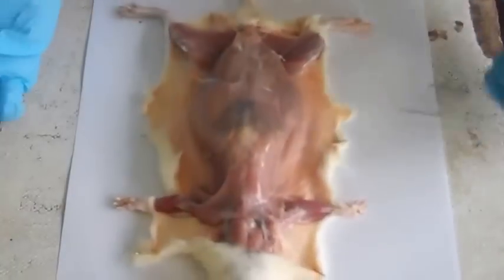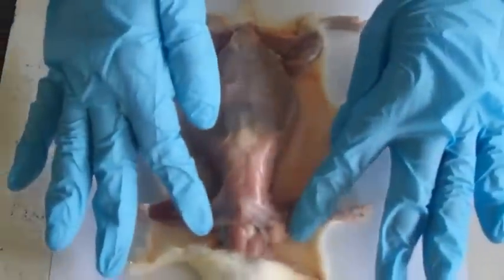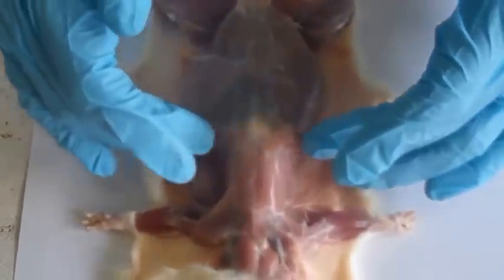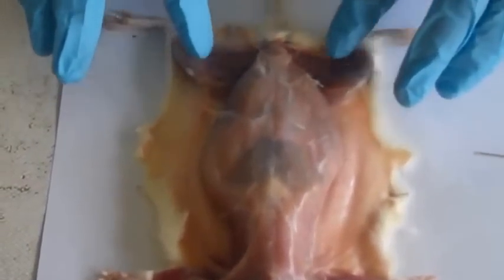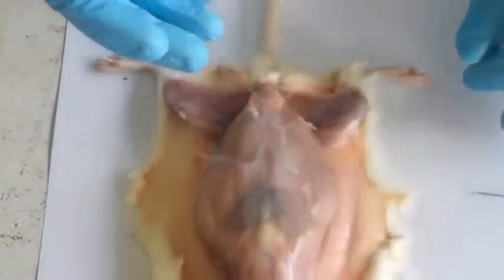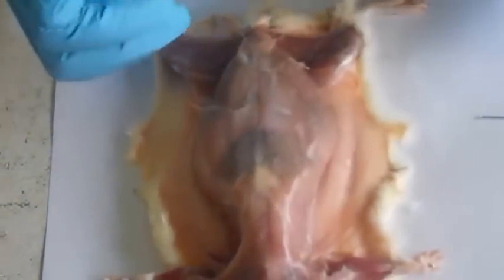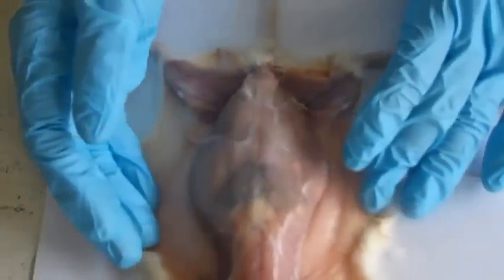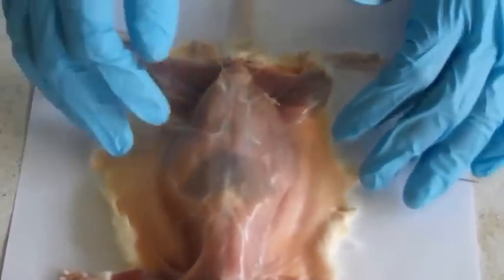Okay, now the superficial structures, we have the muscles. These are the muscles in the neck, then the arm region and the upper part of the trunk, the thorax. There are muscles there, and then also the muscles in the thighs. Then, if it were pregnant, we would clearly see the mammary glands, but since it's still young, probably, we can't clearly see the mammary glands from inside.